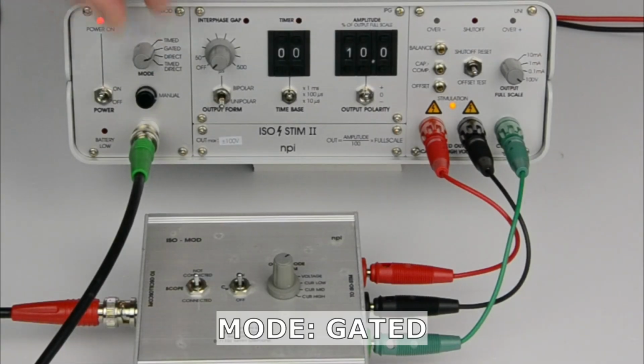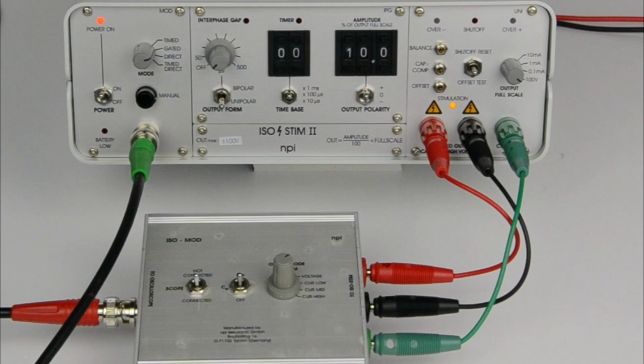Now we switch to gated mode. In gated mode, the length of the output signal will be determined by the length of the TTL input signal. This means that the timer is bypassed. Note that the LED is turned off in this mode. Otherwise, this mode behaves like the timed output mode.